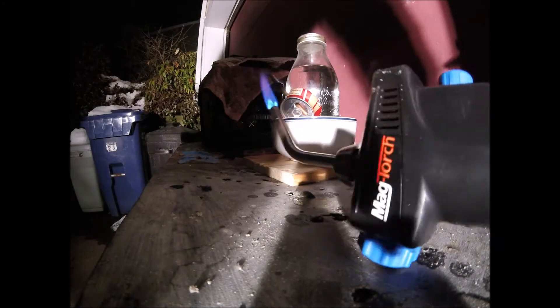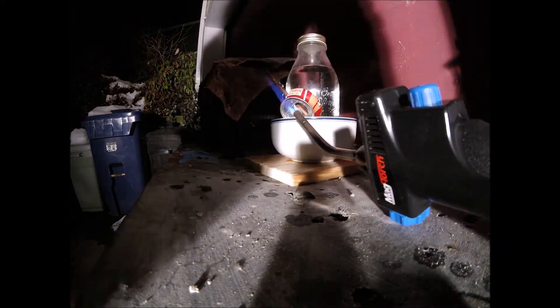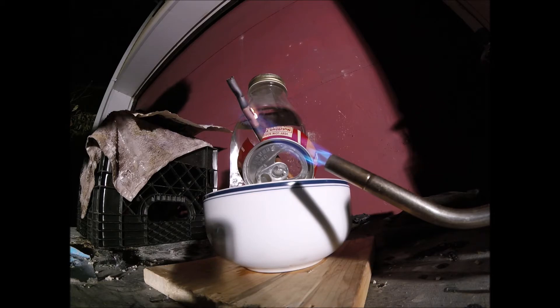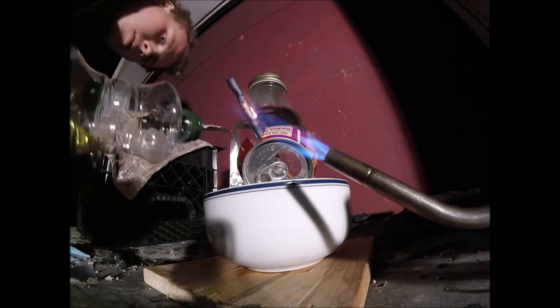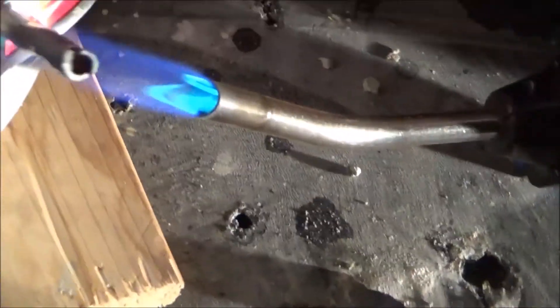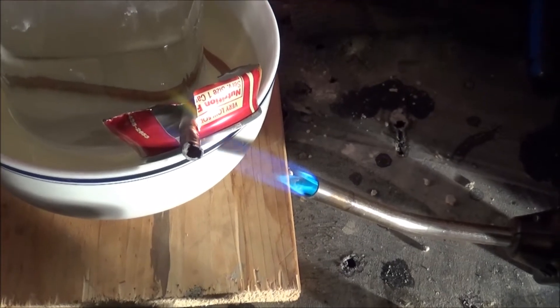So here I am running my heat on this copper pipe which snakes in back there and rests in oil. Hopefully this contraption will work and I won't spill any acid.